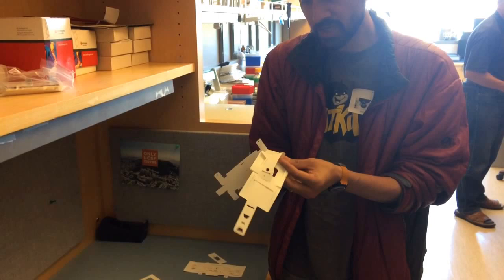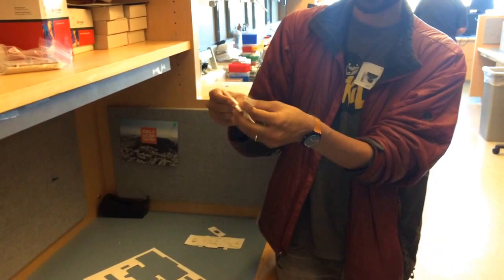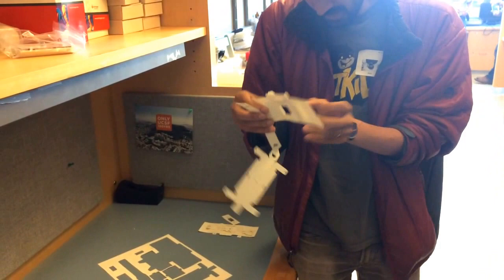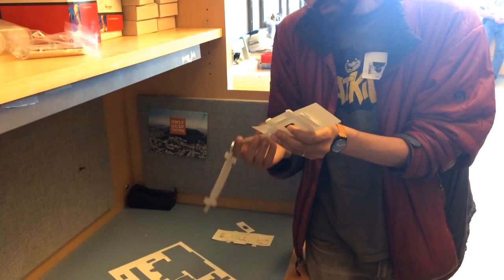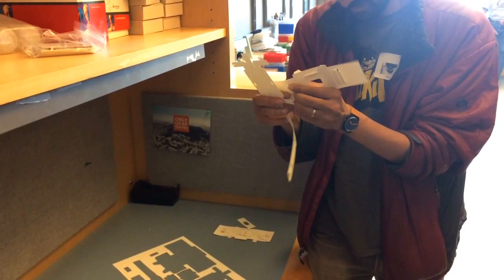So this is the key, that this holds the illumination and this holds the optics, but they are aligned. That way when you move around, you actually get a completely assembled unit where these two components are actually together. And one of the things that I have to now try to do is get this thing out from this side. Inserted completely, set. This piece is getting in the way.